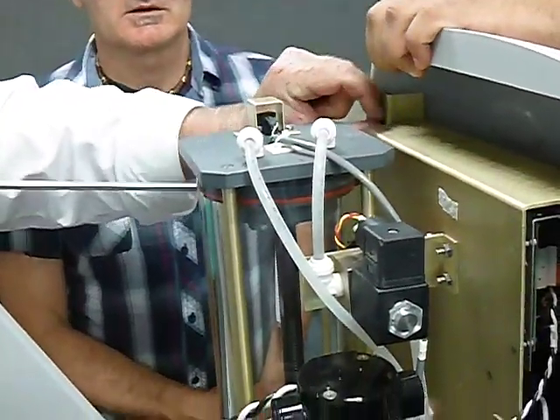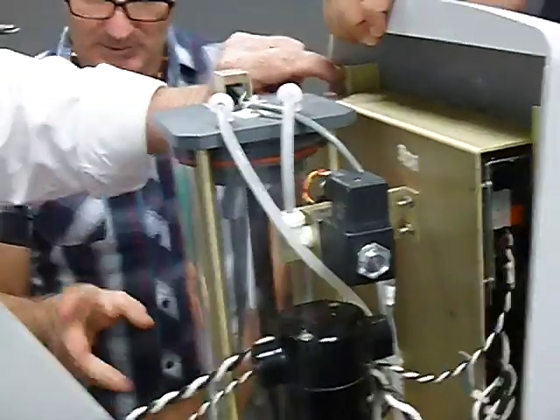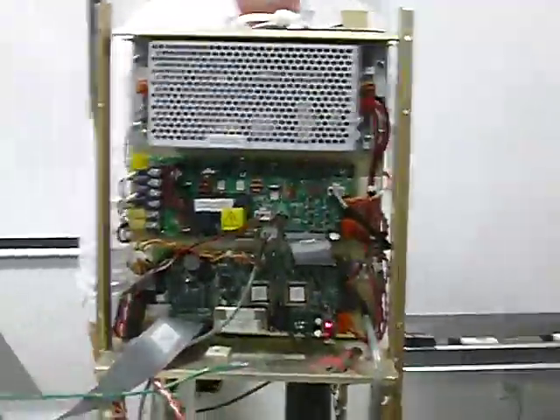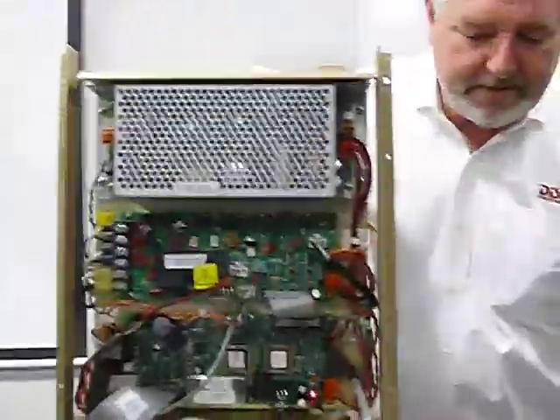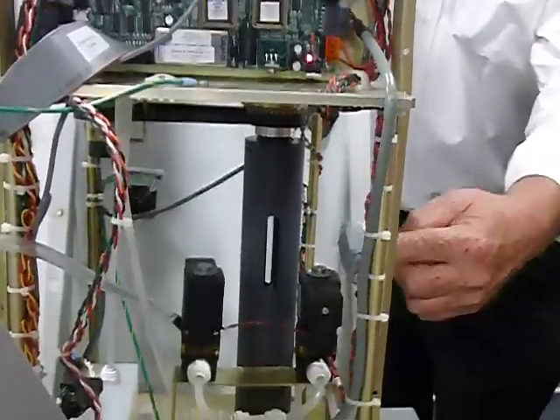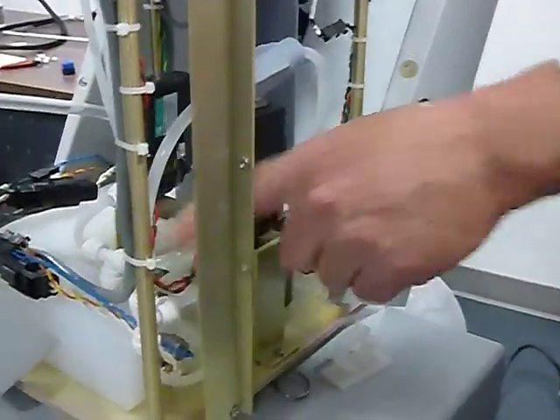Pull that out? Yeah. So Pharma Science has many of those, Pharma Science in Montreal. All right. So no, you just, it will not fall. Yeah, you just lean it there, okay? All right, when it's coming in, it's gonna get sucked up here through this loop, right? It's a one-way loop. Comes into the solenoid, all right? Goes into here, and it goes into the heater block.